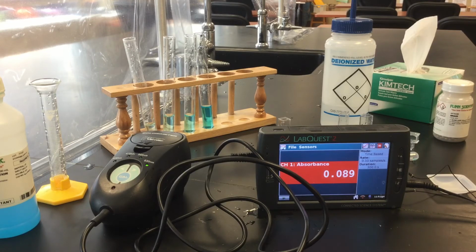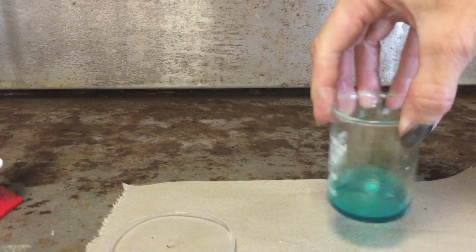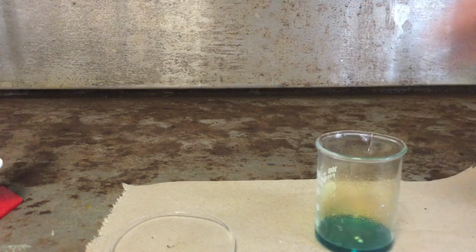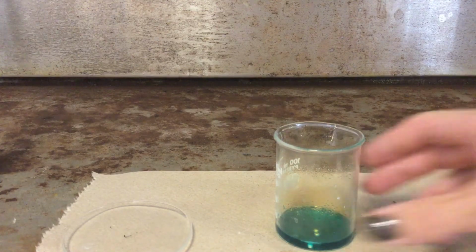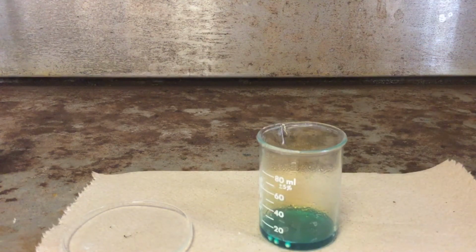So let's go take a look at how the BBs are doing. There's still a little bit rolling around in there, but for the most part, oh, look at that, we still got some nitrogen dioxide, so we don't want any of that.